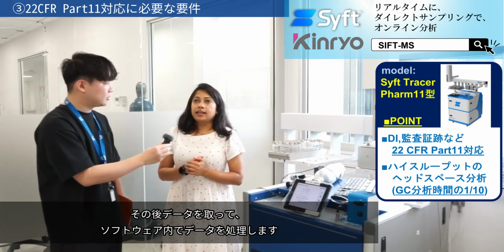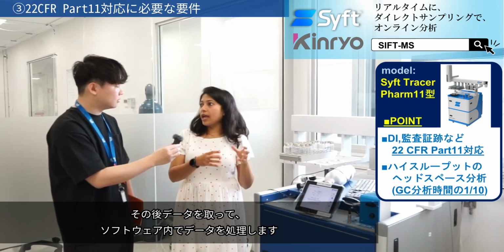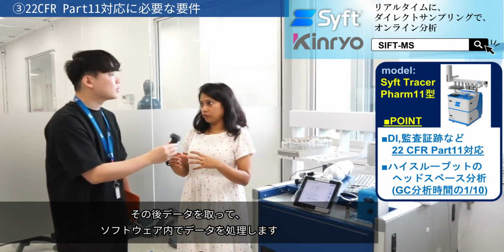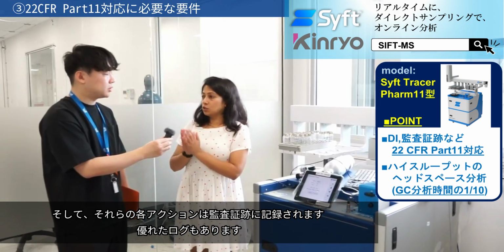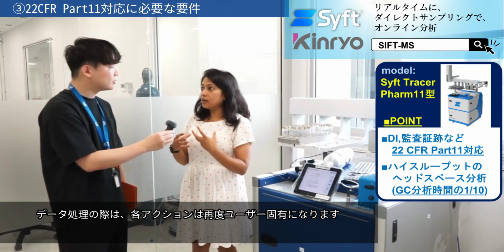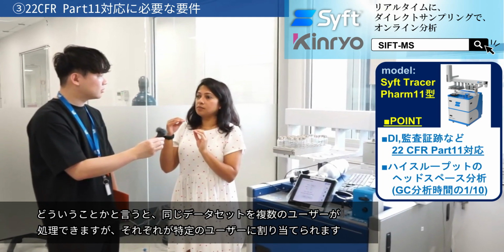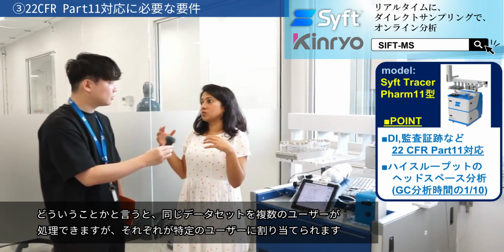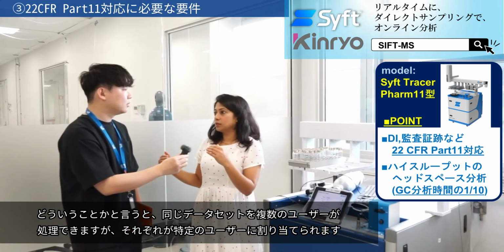And then you have data acquisition. So you can acquire data and process data within the software. Each of those actions is again recorded in the audit trail. There's a good log as well. When you process the data, each action is again tied to a user. So the same set of data can be processed by multiple users, but each one is specifically assigned to that particular user.